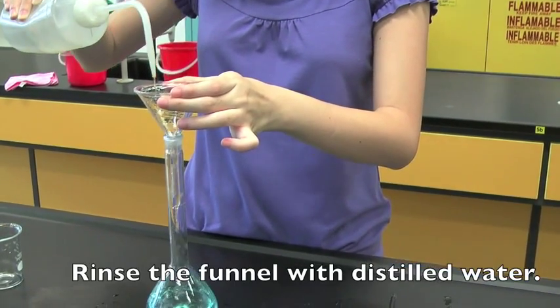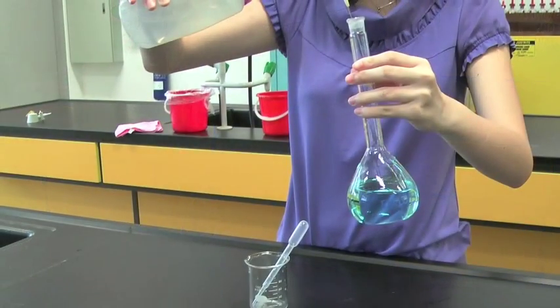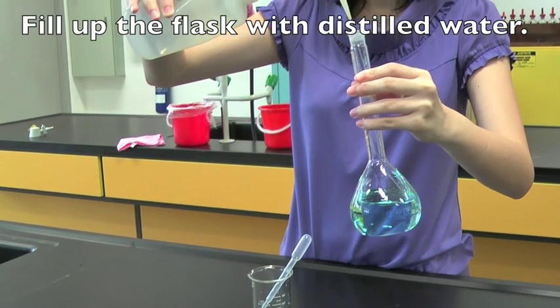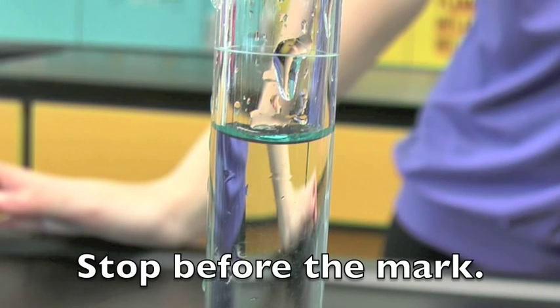Next, rinse the funnel before filling up the flask with distilled water. Stop before the mark.